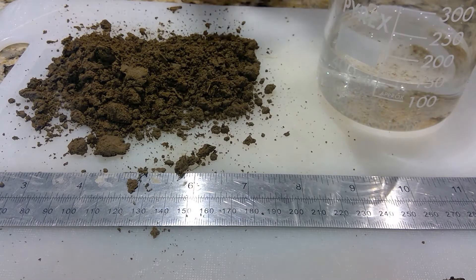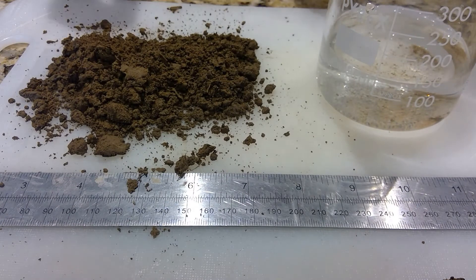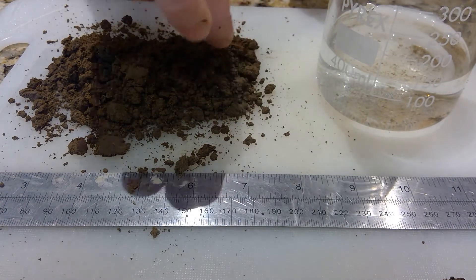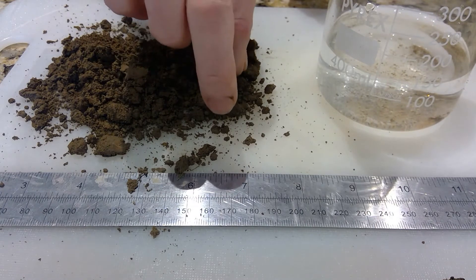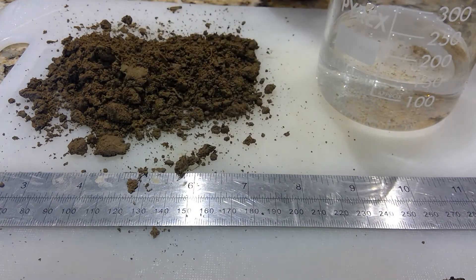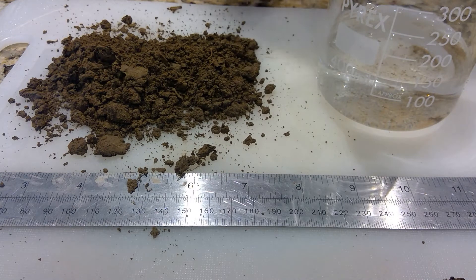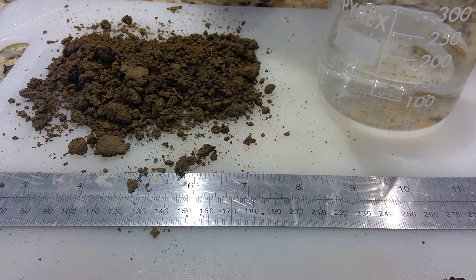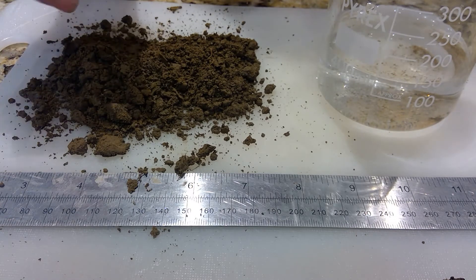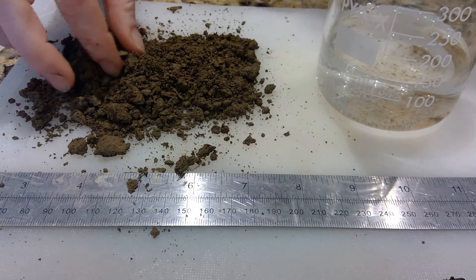So what do we need for this experiment? We need a ruler, we need water, and most importantly we need a soil sample. This soil sample has come from a field at home. I took about five samples from an area of about half an acre, from areas that would represent that portion of land fairly — staying away from water troughs, feeding areas, ditches and gates.